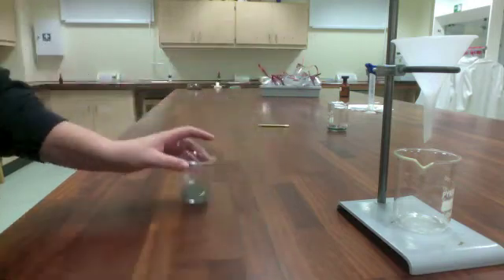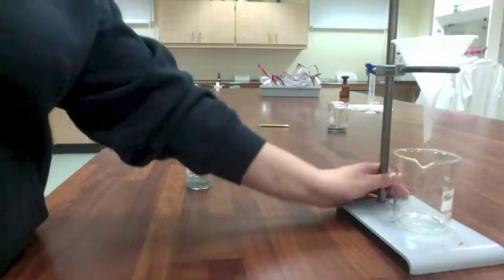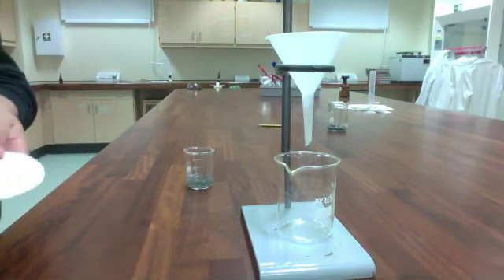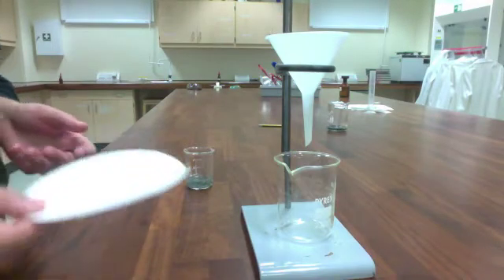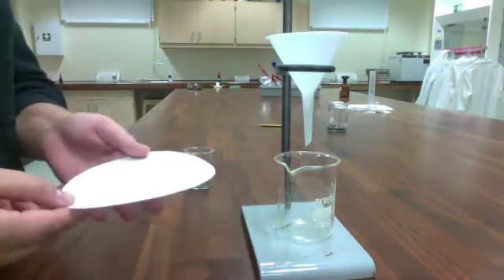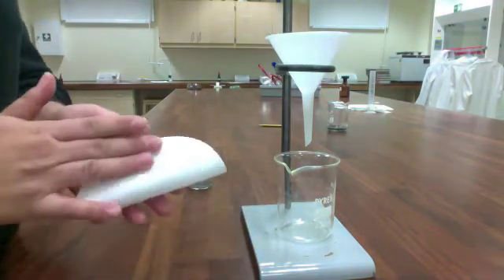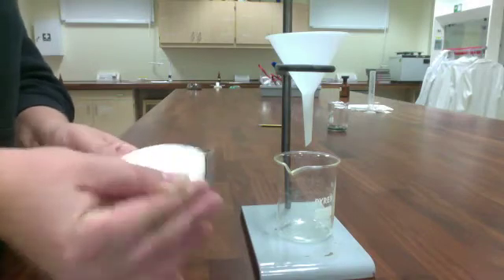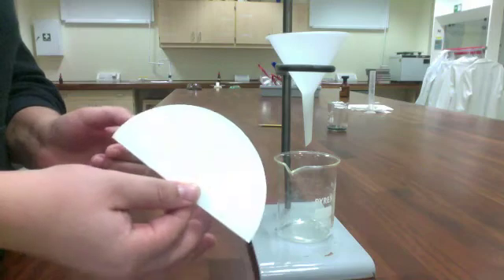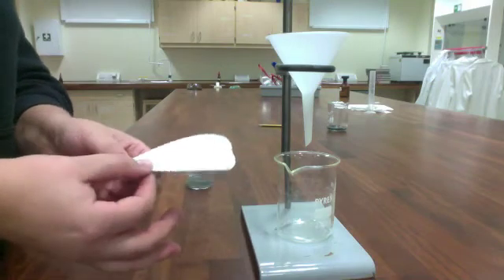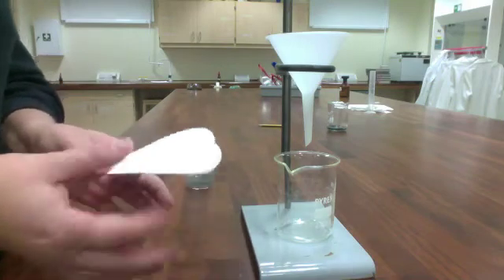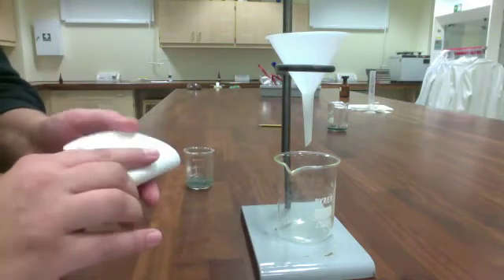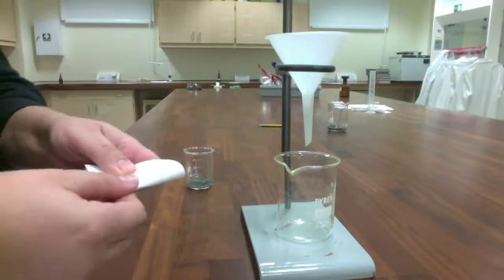And so I have a filtration apparatus set up here. Just a funnel being poured into a beaker, and what I'm going to need to add to that funnel is a little piece of filter paper. So I'm just going to fold that, and very carefully, the easiest way to make filter paper that's going to work correctly is just fold the filter paper in half, and get that crease as sharp as you can without using your nails. If you use your nails, there is a possibility you could tear the filter paper, which of course would let more go through than we want to.